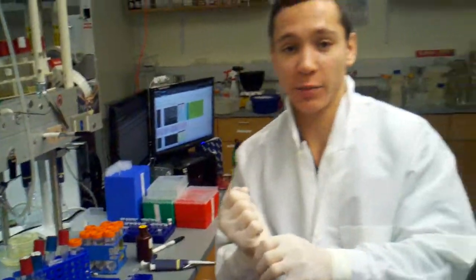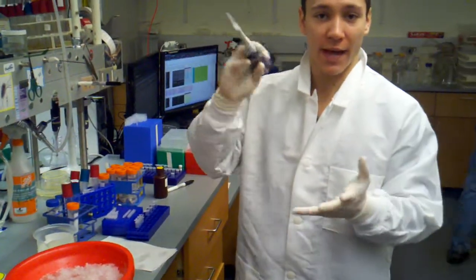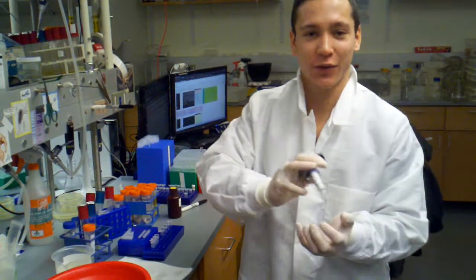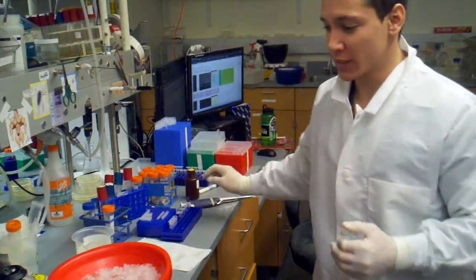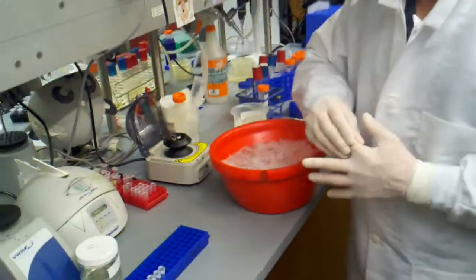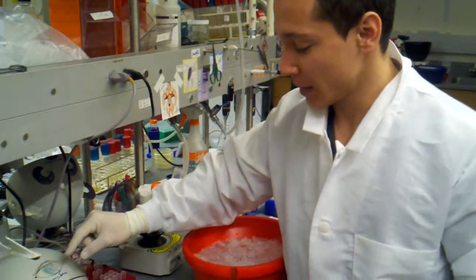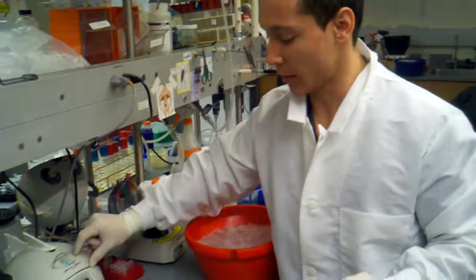And what I wanted to do was actually pull off all of the excess glycerol with my pipette. But again, that pellet wasn't a real pellet. It started as a pellet at the bottom, and that kind of turned into like loose cell goop, and then the clear glycerol. So hopefully after this spin, we're going to see a very nice solid pellet that we can aspirate off all of the excess glycerol. And when we're taking that glycerol off, we're removing all of the impurities from our pellet.